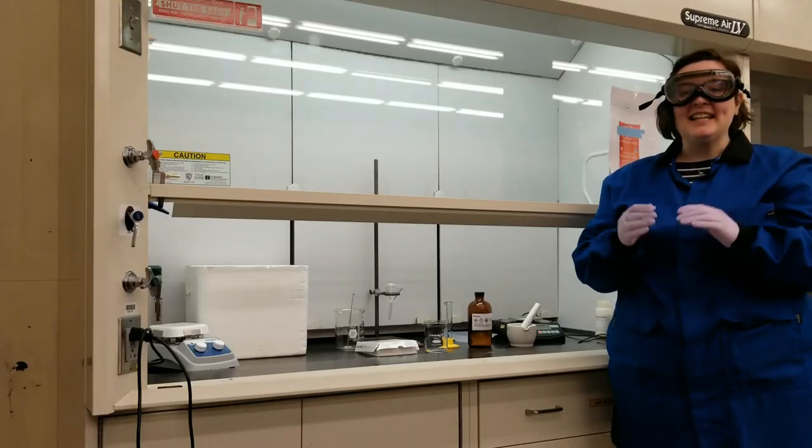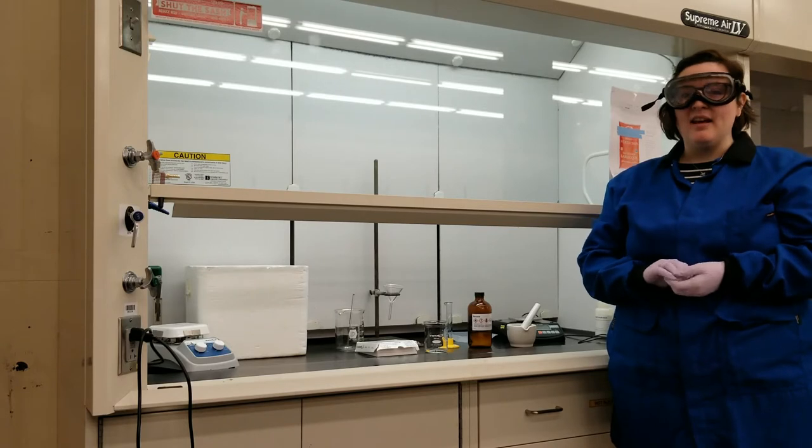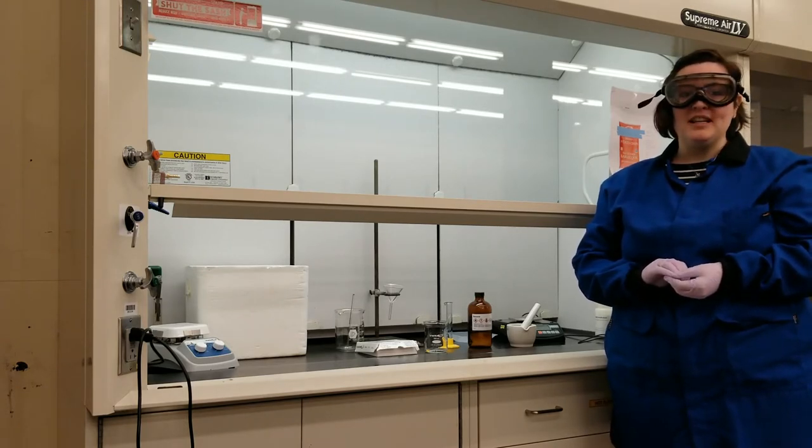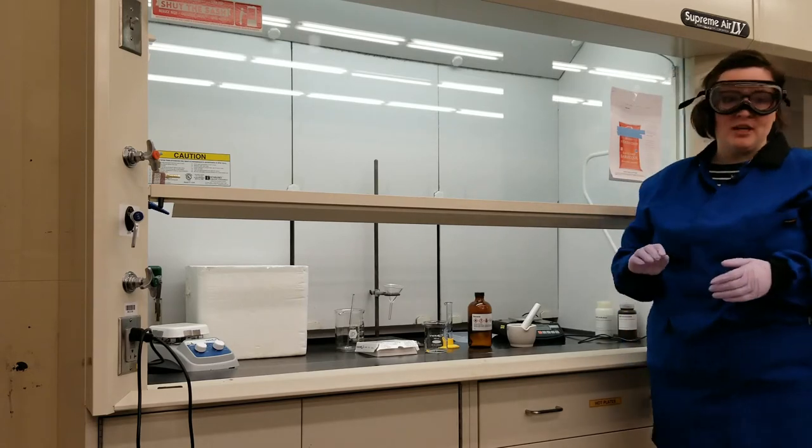Hi, my name is Emrys, and today I'm going to be doing Lab 7 of the 107 labs, or the 109 labs, which is extracting some fat from some potato chips.